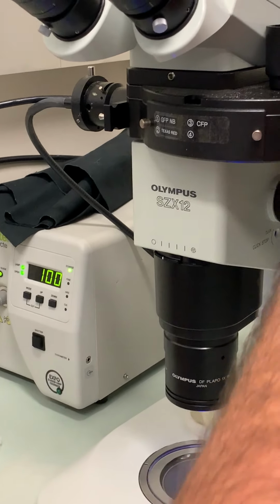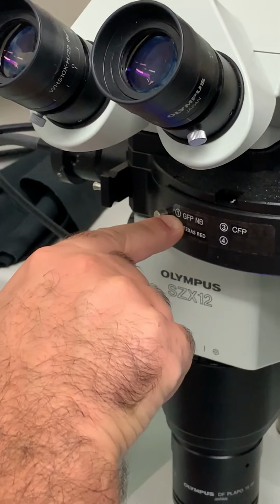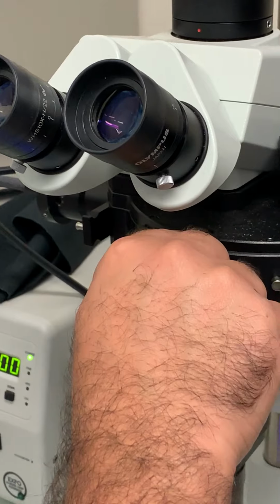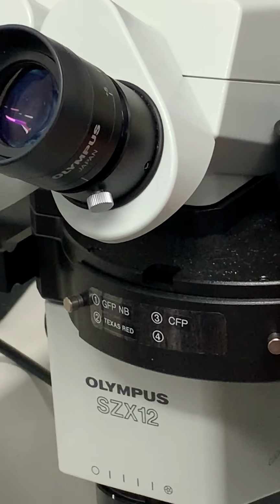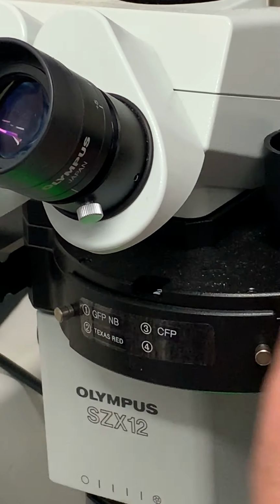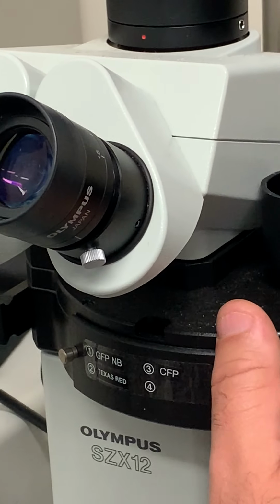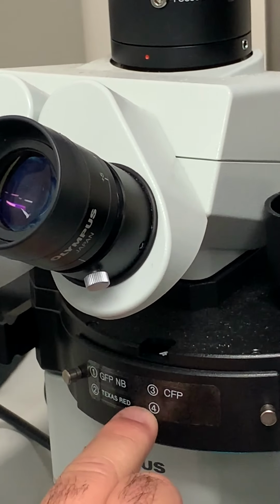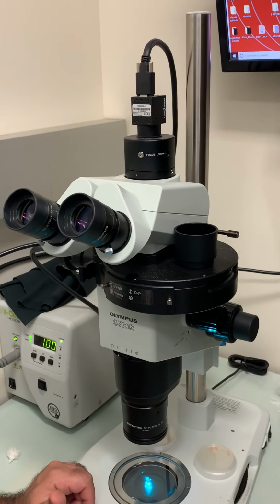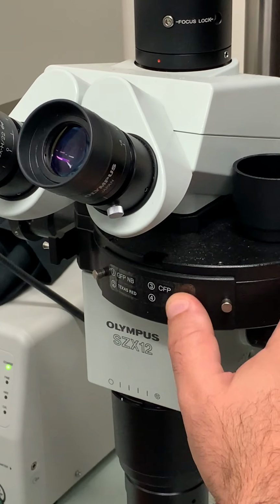And the last thing is the filters, and this is the wheel. You can see here it says the number 1 filter is for GFP, and you can see the number 1 up on the top here. So when you move this wheel, you can move it to number 2, which is now for Texas red, and number 3 should be for cyan, although it doesn't look like it's there. Oh, actually it's number 4, so the cassette for cyan is in number 4. No big deal. So we're gonna move it to number 1 because that's where the green is.